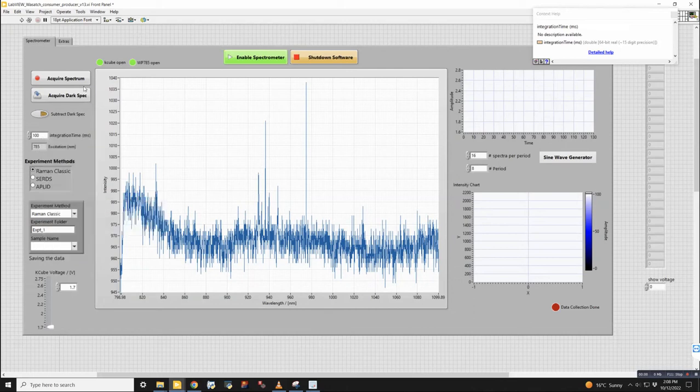It's not really necessary though, because this is just to get the instrument going. And then once it's running, you can change the integration time to be whatever you want. But for instance, if it was running at 10 milliseconds and I'm not really going to get a good signal with just about anything by default all the time, then it's not really useful to have that value in there. I thought 100 was good enough where you'll see data coming in really quickly, and you should be able to see some kind of Raman spectrum if the laser power is high enough. But this is all just preference at this point.